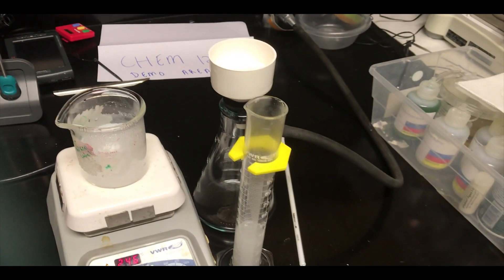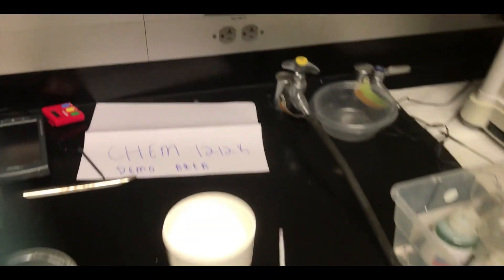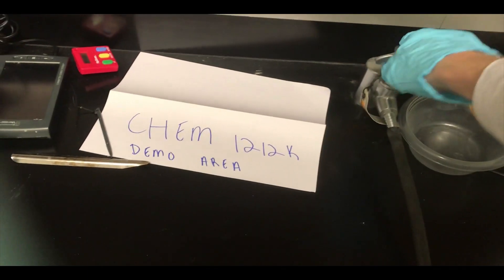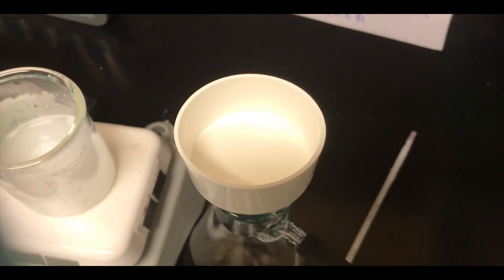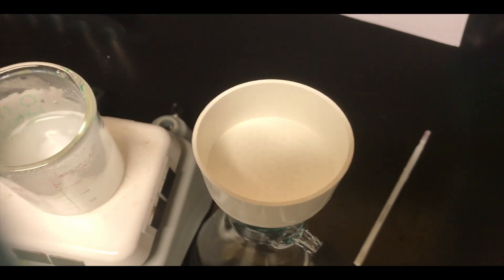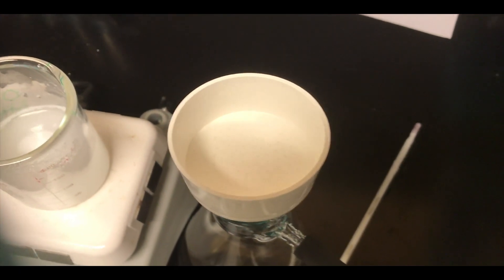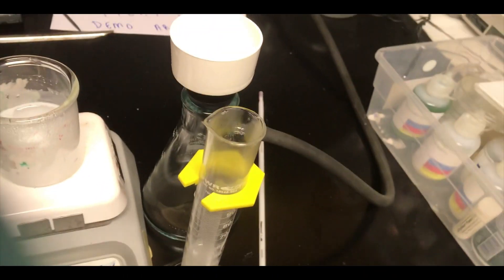That's going into the Buchner funnel, so I'm going to go ahead and turn the vacuum on. And I should add that at this point you should act pretty quickly, because you don't want too much solid to precipitate as that solution in the graduated cylinder cools.